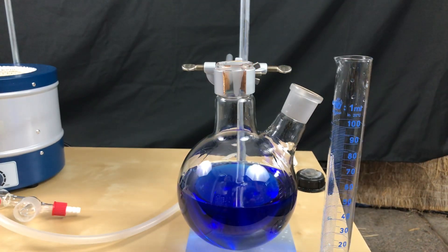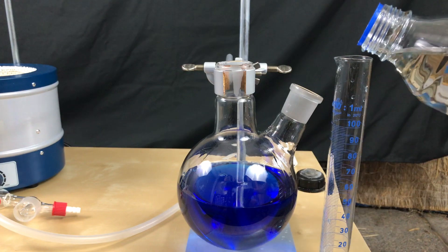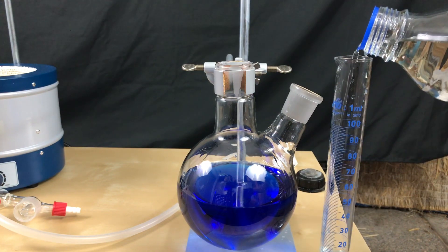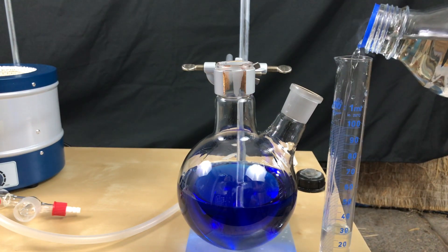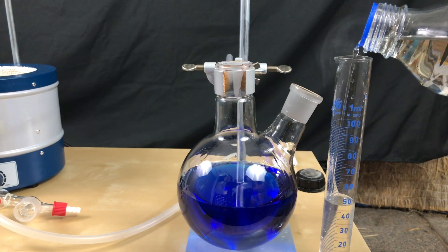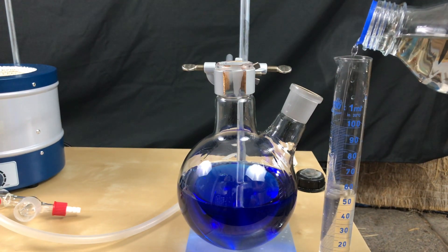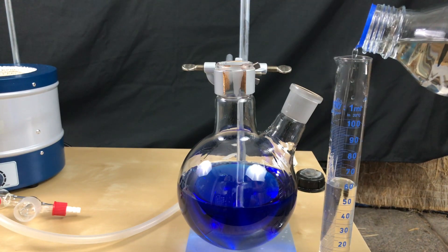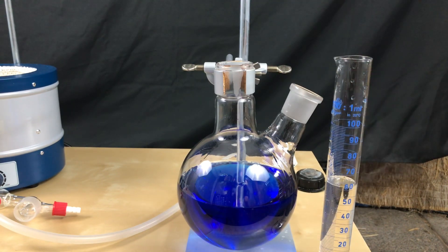Afterwards 65 milliliters of our 96% sulfuric acid are measured out. The mysterious smoke you see here is probably some acetaldehyde or a byproduct of sulfuric acid reacting with the dye of our antifreeze.